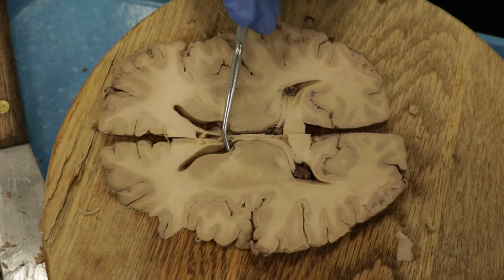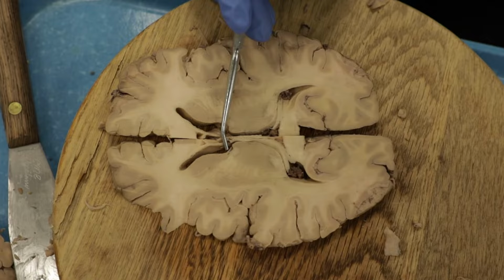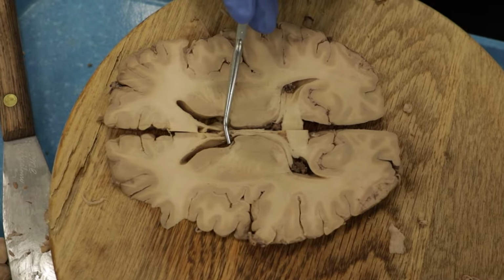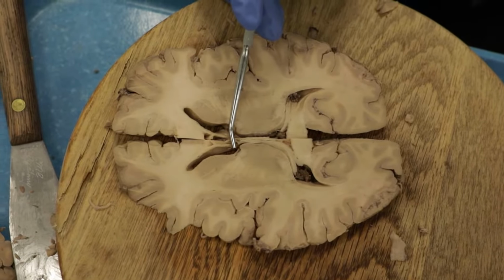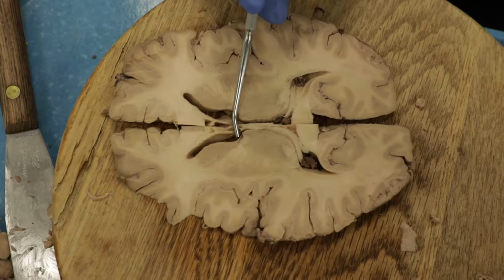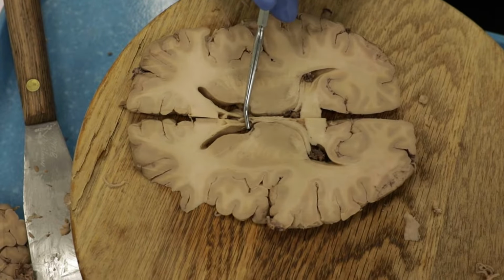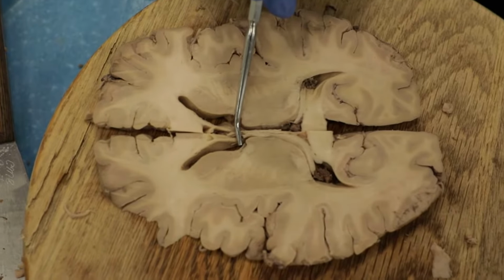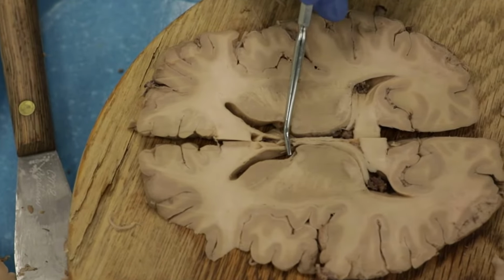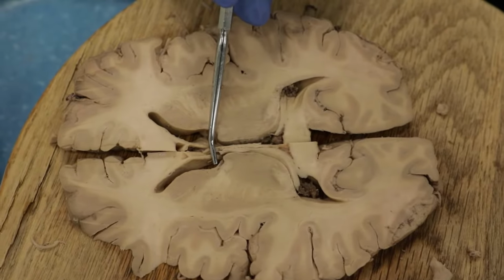So the stria terminalis, although small, is important because when we talk about our fight or flight mechanism, when the sympathetics kick in response to something scary that happens, well, that's the amygdala, that's your alarm switch in the brain. And so for the amygdala to activate the hypothalamus, it does so through the stria terminalis. And when the hypothalamus is activated, that's what kicks in your sympathetics, which activates the adrenal gland, and everything else that makes your blood pressure and pulse go up. So that's the importance here of pointing out the stria terminalis.